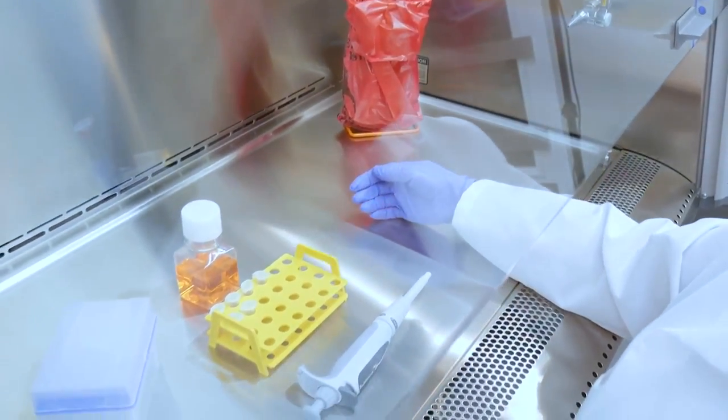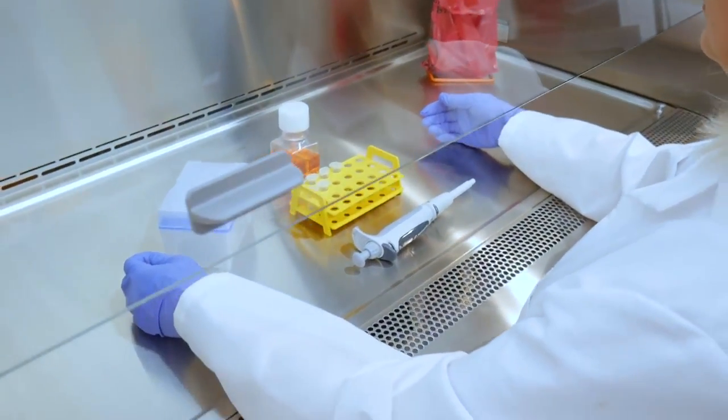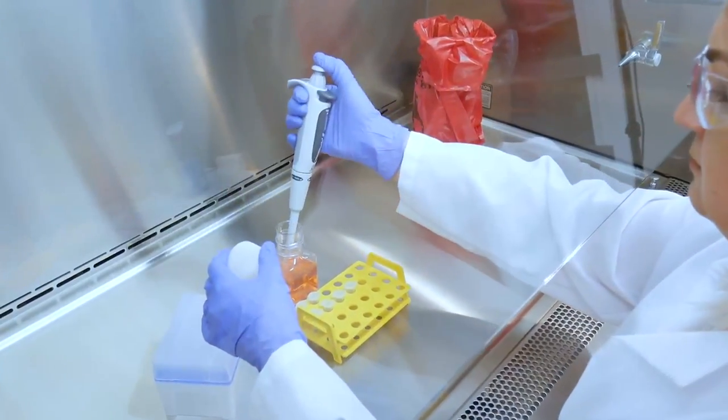LabConco BSCs have an integral armrest in the front airfoil, so it is okay to rest your arms on this grill. Be sure to work at least four inches into the cabinet from the front airflow grill.